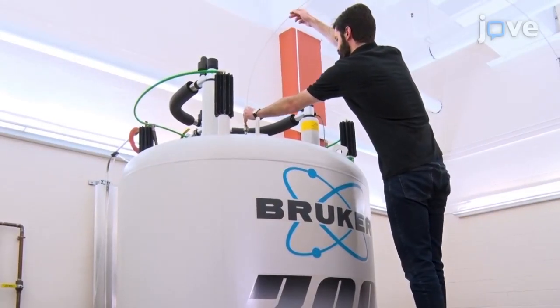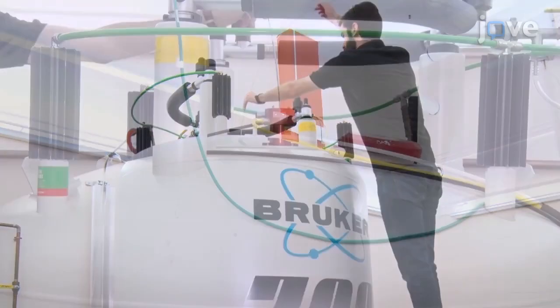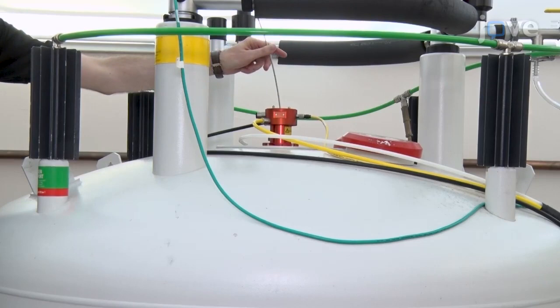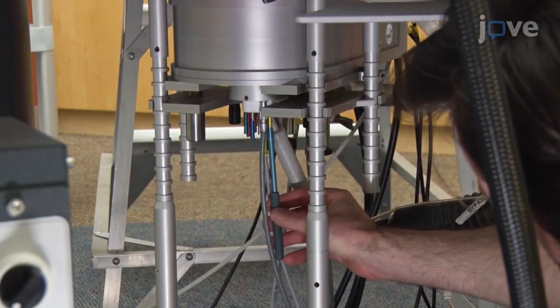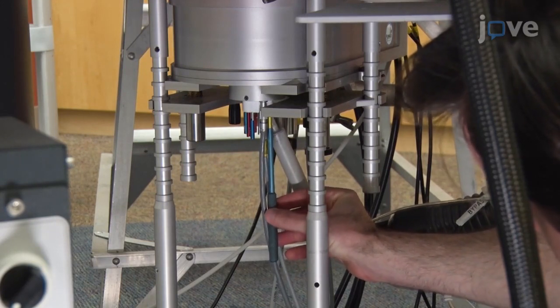Insert the unpressurized tube into the spectrometer by carefully guiding the tether line. Slide the tube into the spectrometer until the tube reaches sample sitting position. Lock, shim, match, and tune the protium and nitrogen channels, and save the optimized shims for future.